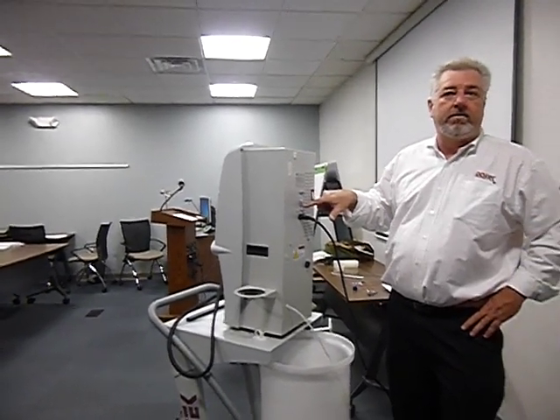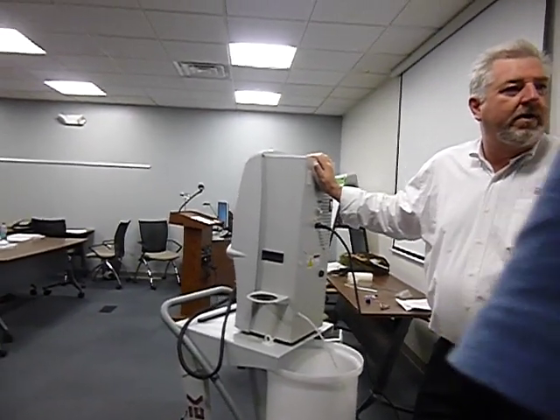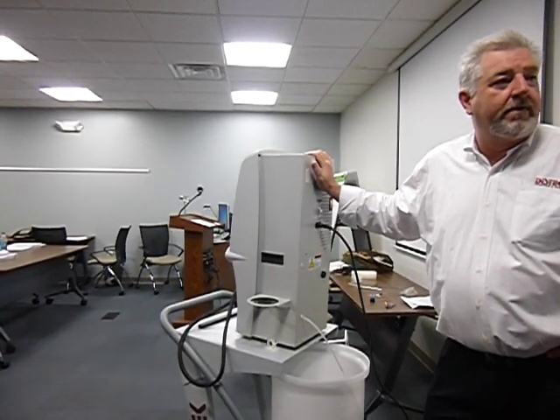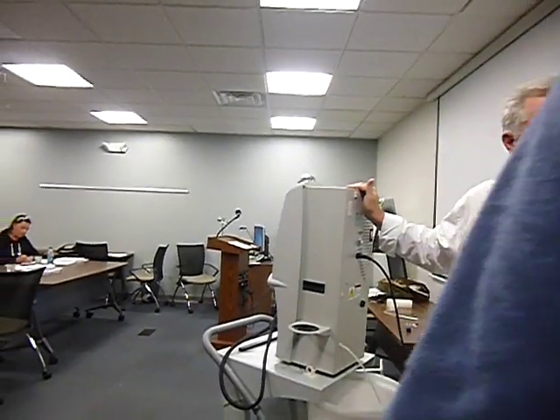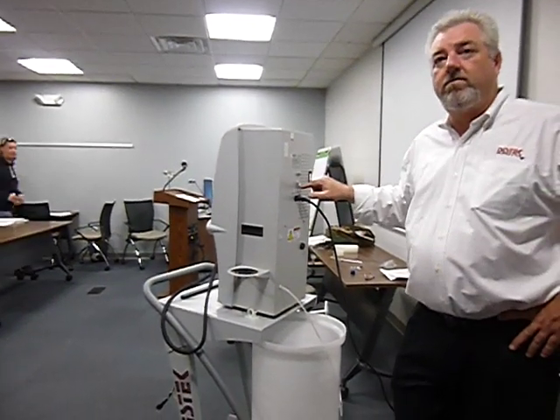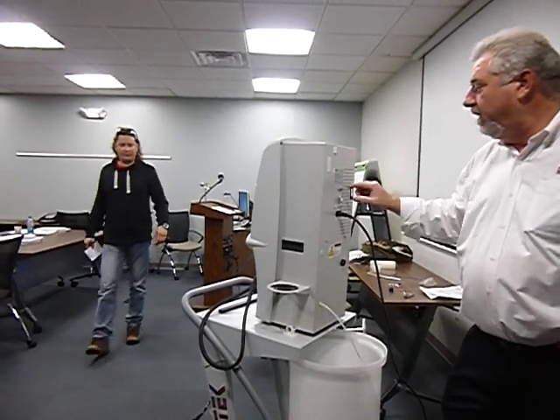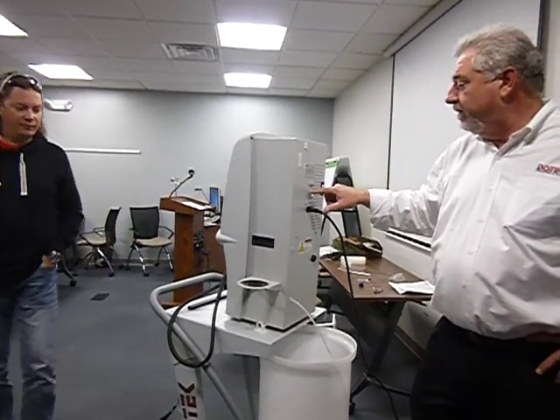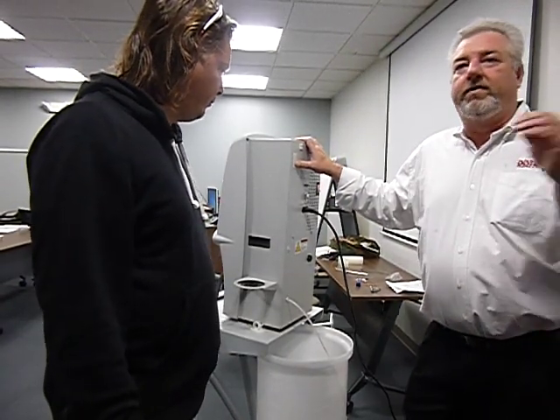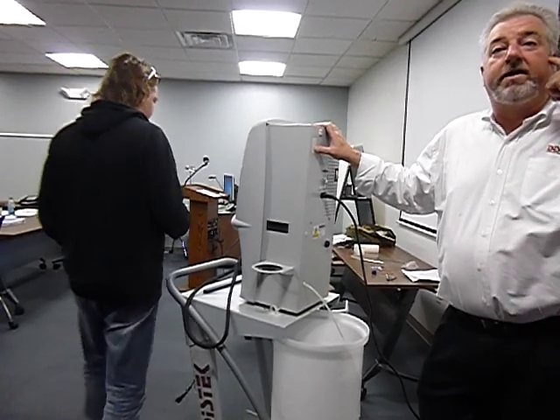I did it through USB once, but it was many years ago. The USB port is for the firmware upgrades when you connect the printer. Yes, it's always been there, the square one. And the 232 is for commands, say you want to put it to the original calibration data, or any of the other commands that are in there. There's a lot of commands.